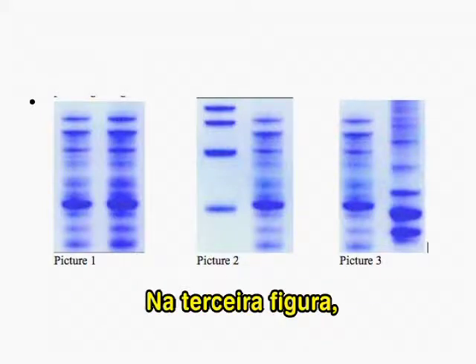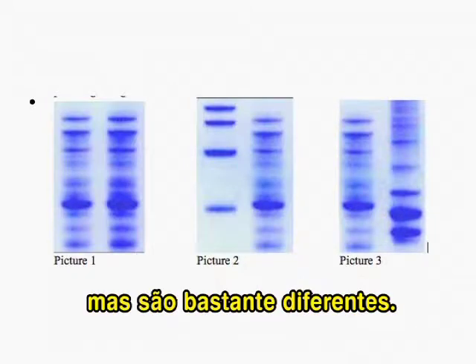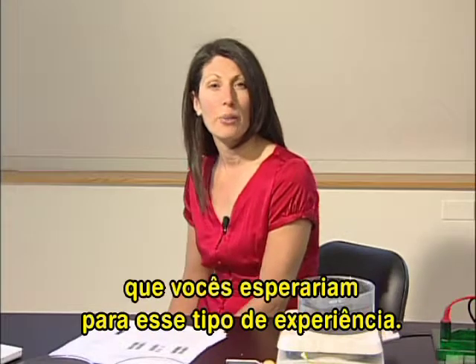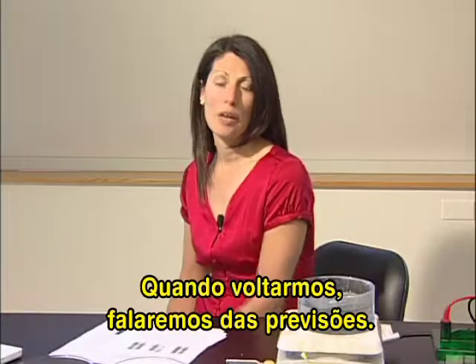And in the third picture, it looks like there are many proteins for both types of peas, but they're quite different from one another. So I'd like you to take some time and think about the kind of banding pattern you might expect for this type of experiment, and then come back and we'll talk about your predictions.